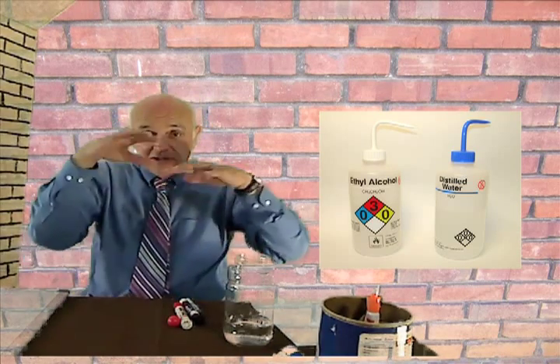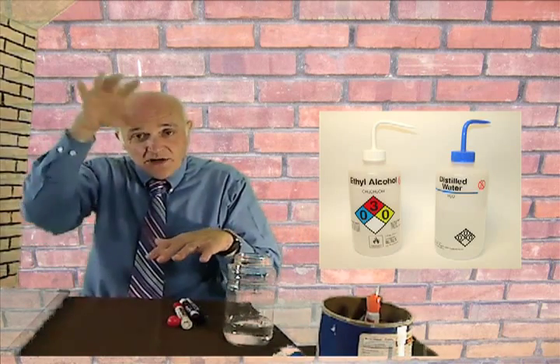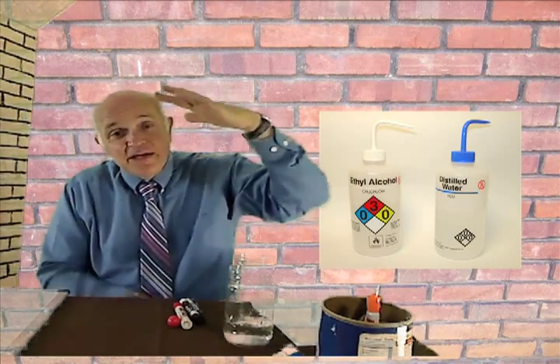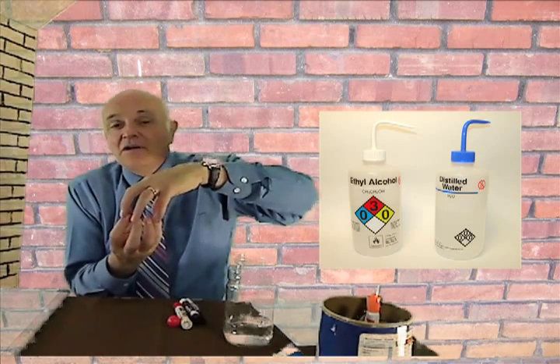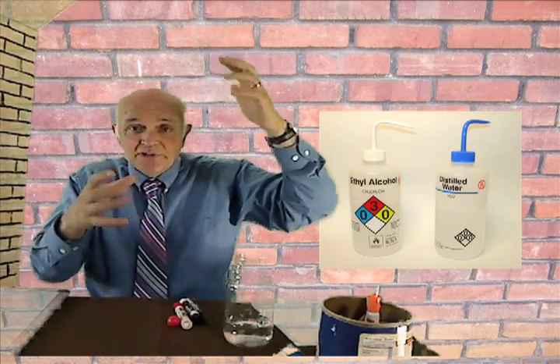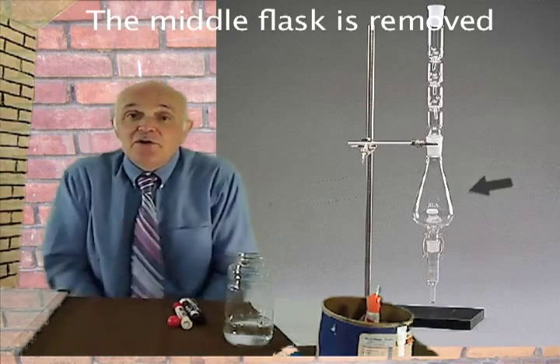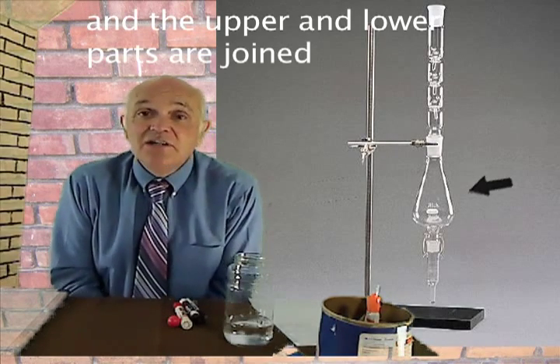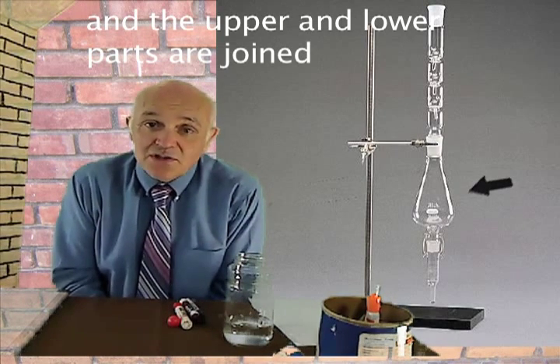And then as it goes down and down, the operator gently washes it down, and as it goes down below the big column and goes into the graduated part, the operator makes one last rinse, quickly takes it apart, takes the big flask away, puts the Snyder column right onto the graduated cylinder part, and keeps going, carefully washing it, carefully watching it, washing and evaporating it.